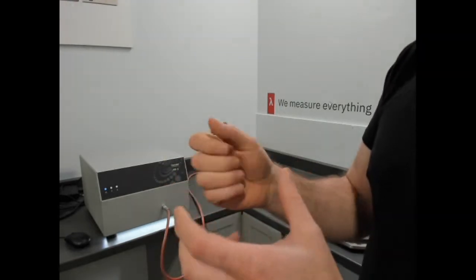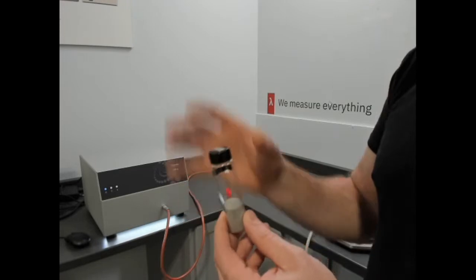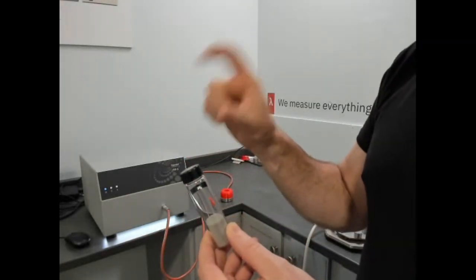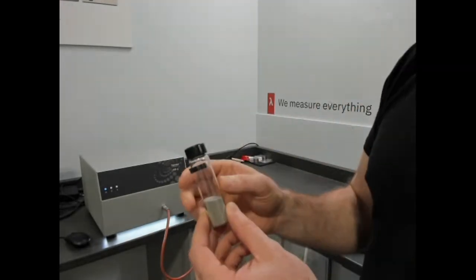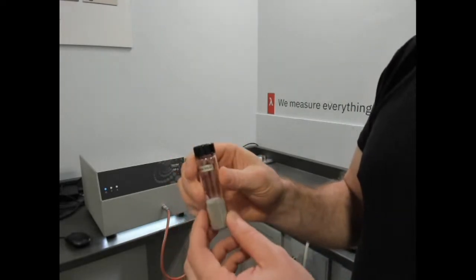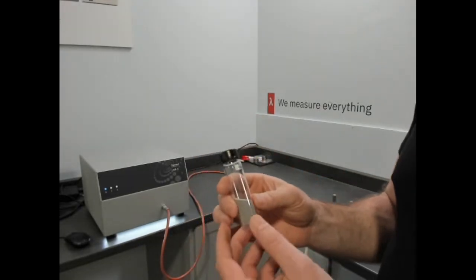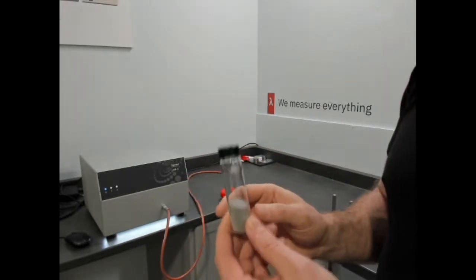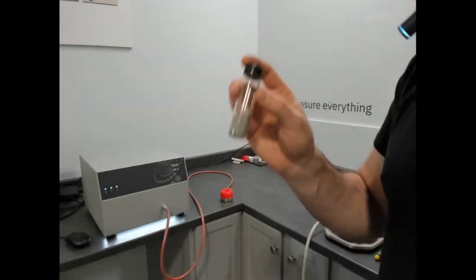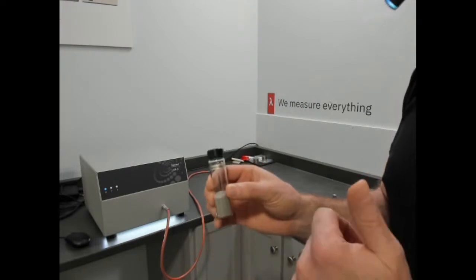That means the ambient density is very similar to different changes in force to try to affect the density. Materials that have different particle sizes, different particle shapes, and different densities are much more susceptible. That's why this makes a good demonstration, because we get to show you different setups and have similar numbers, which you'll see. So again, this is a 3D printed titanium alloy, and we'll be demonstrating that.